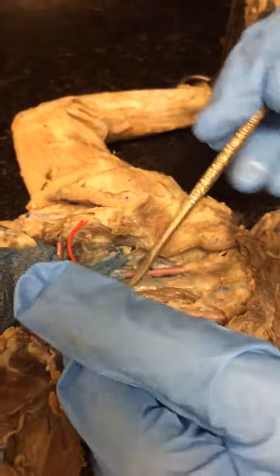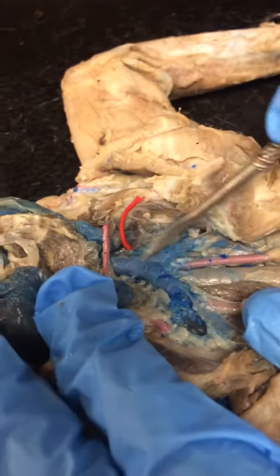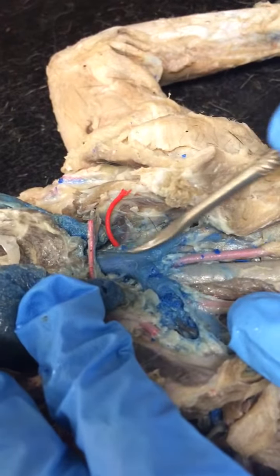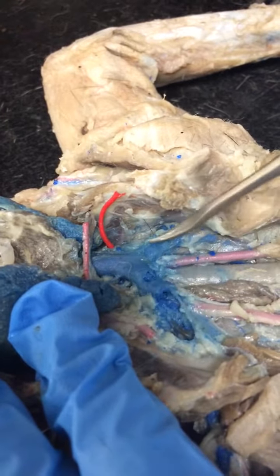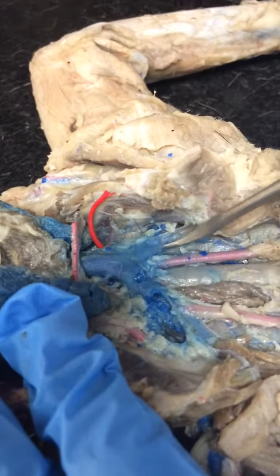Going down again, you can see here in the vein, right, so first and foremost, this big part right here, that is the anterior vena cava, okay? It forks into the two innominate veins. So this is an innominate vein, and this right here is an innominate vein, okay? So that's that fork, all right?